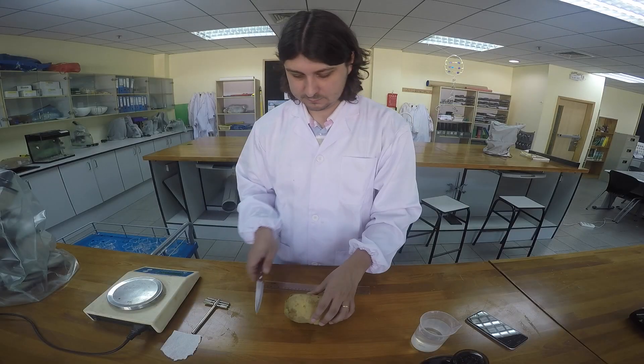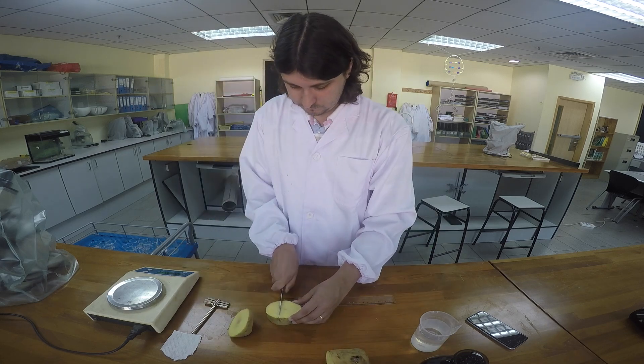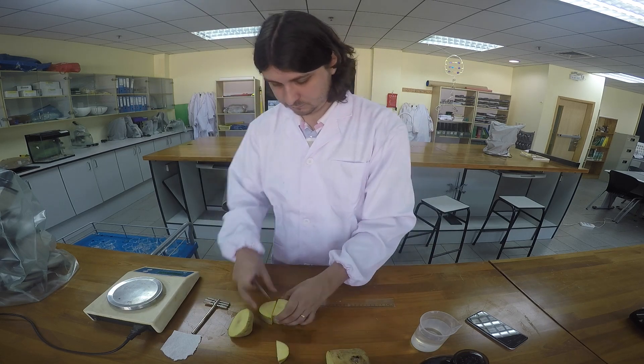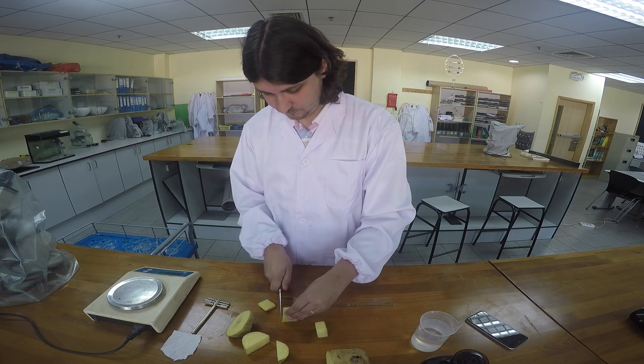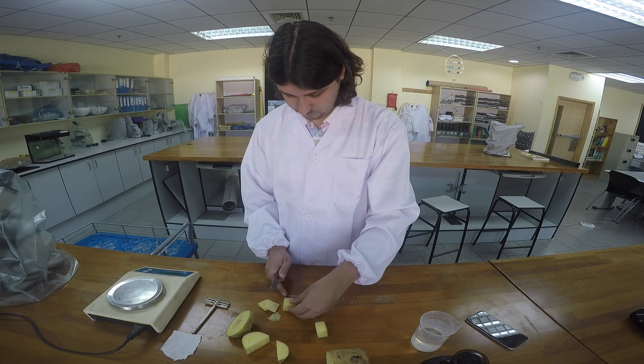This lab is typically done with agar cubes soaked in a BTB and acetic acid solution. I've always found the agar cubes too flimsy for students to manipulate and quite difficult to make in different sizes. So I've substituted them with potato cubes and an iodine solution. Each student receives a large potato cube and cuts out 5 cubes — the smallest is 0.5 cm per side and the largest is 2.5 cm, with 0.5 cm increments, for a total of 5 trials.